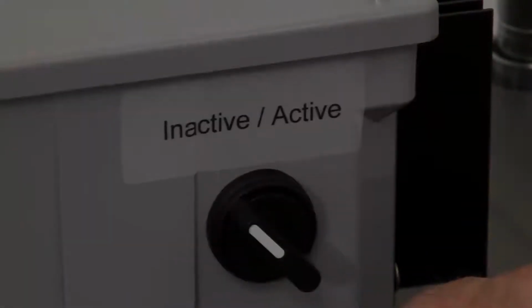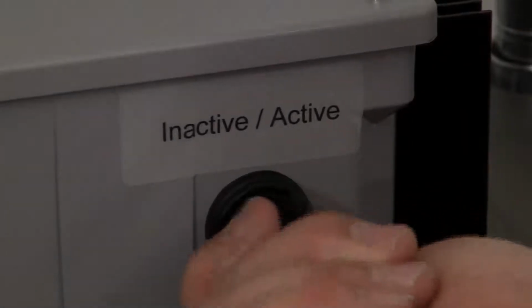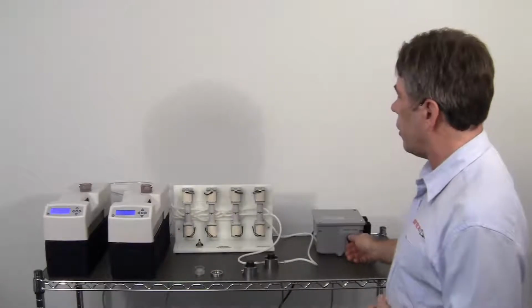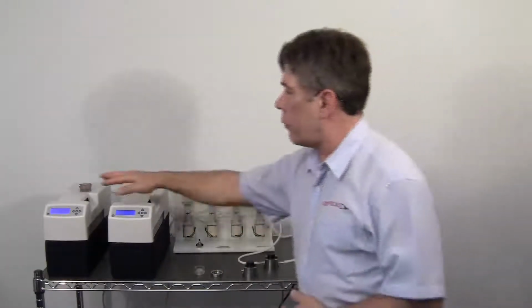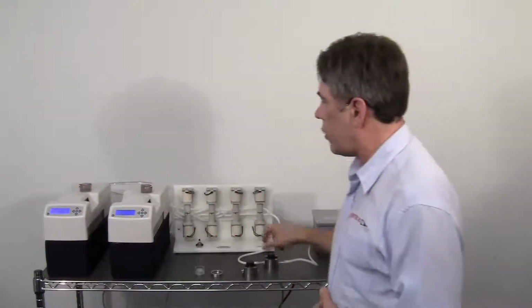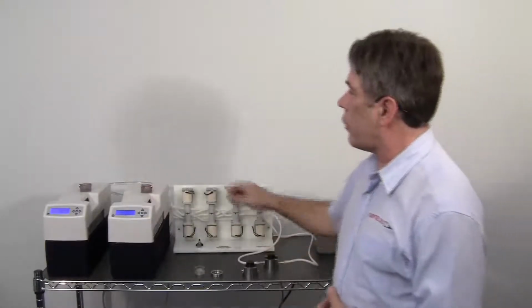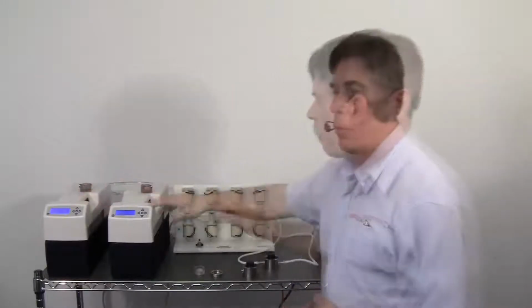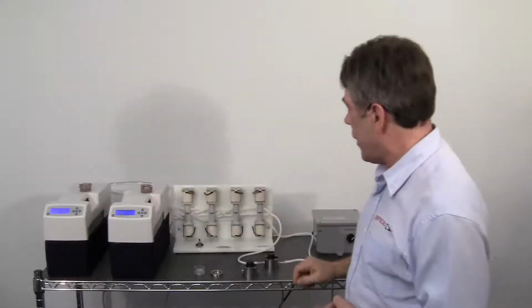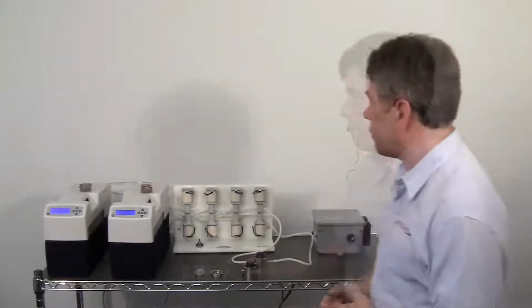Over here is a power supply that the solenoids plug into, and you'll see when we throw the active knob on here, it energizes all the solenoids, and that causes the flow to go from this nanotherm through the device instantly, and then it'll turn around and short cycle back into the first nanotherm. So in other words, whichever nanotherm is feeding the embryo chamber, the other one gets short-cycled.